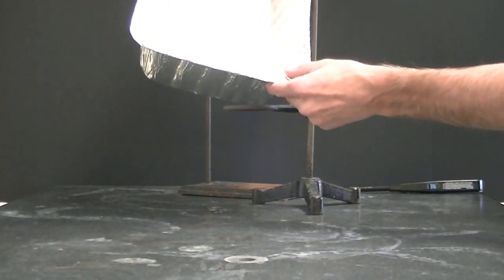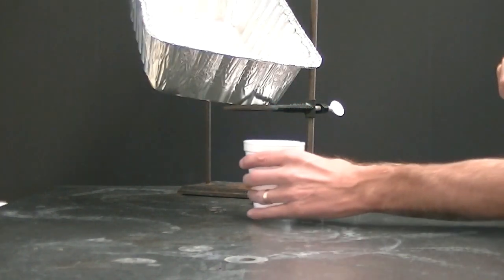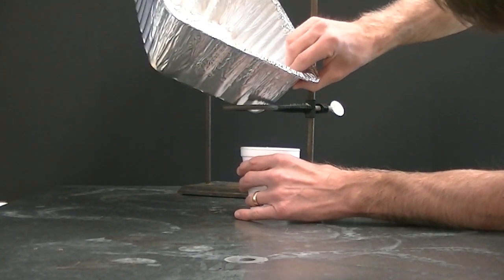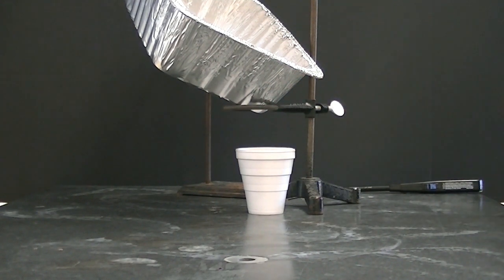I'll sort of balance the system here and I'll place a cup beneath it where I can collect any liquid oxygen that condenses off of the aluminum pan.